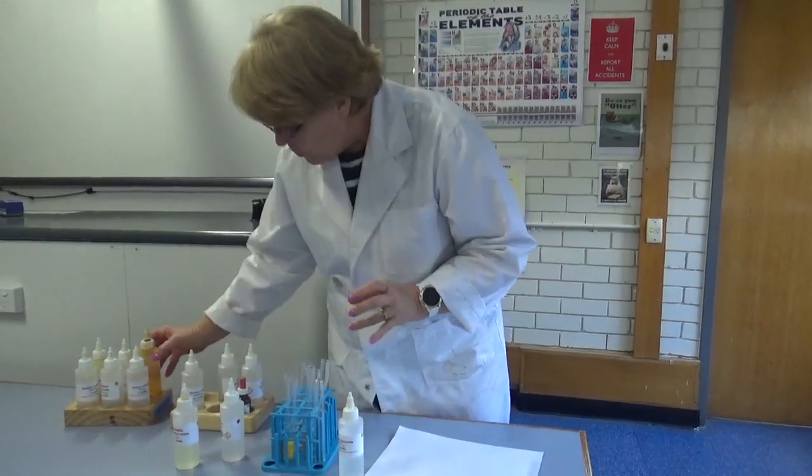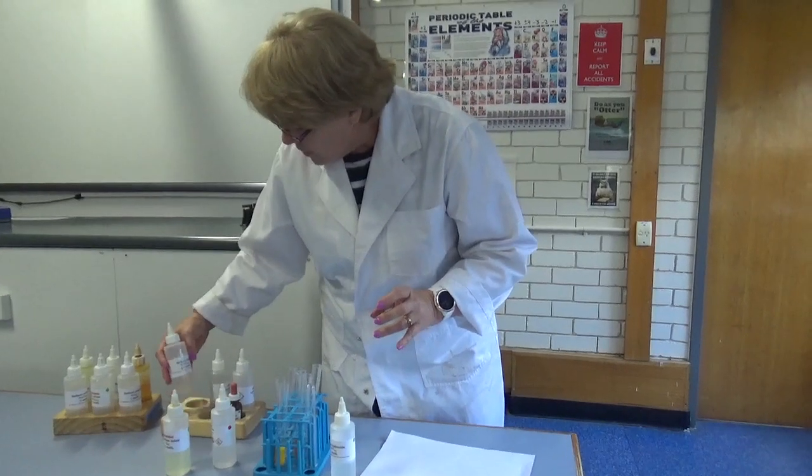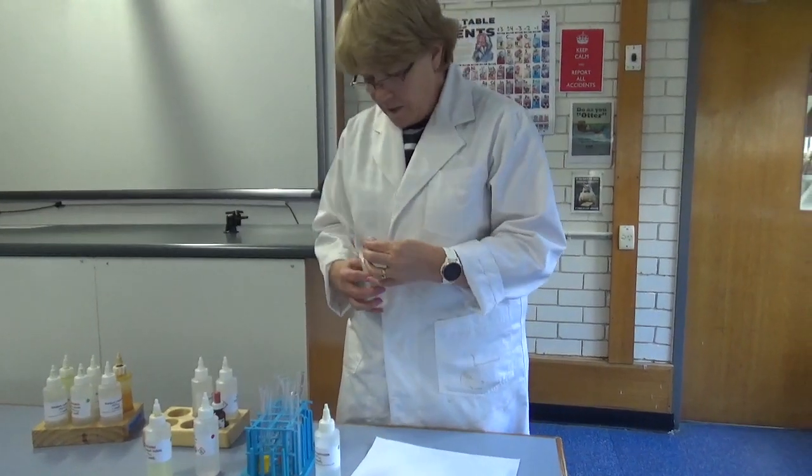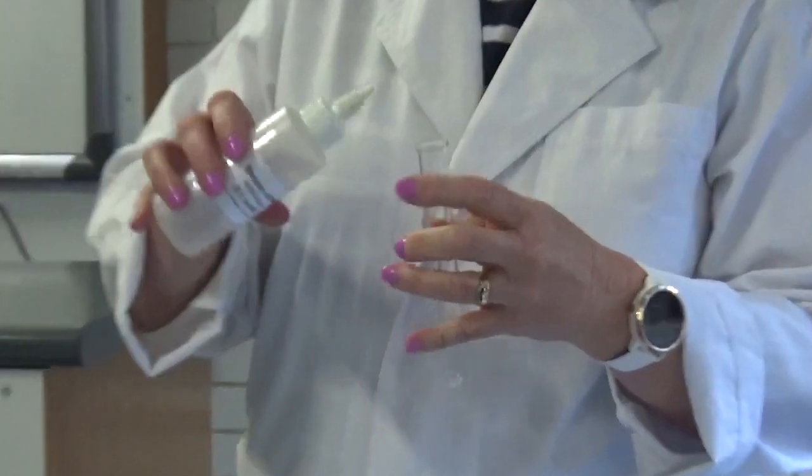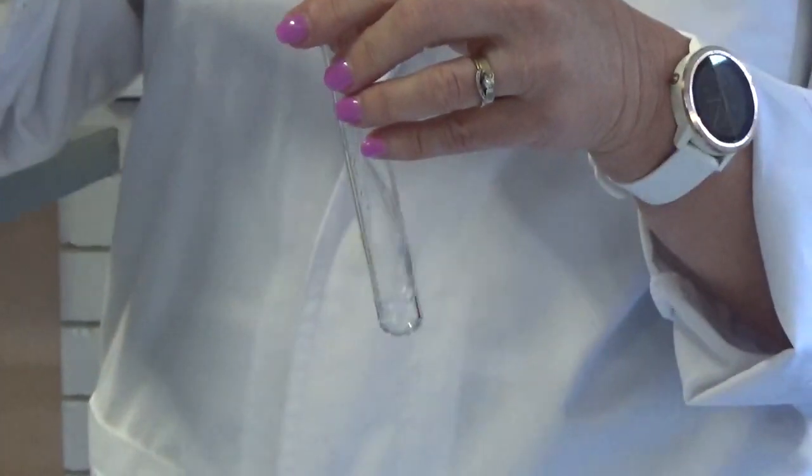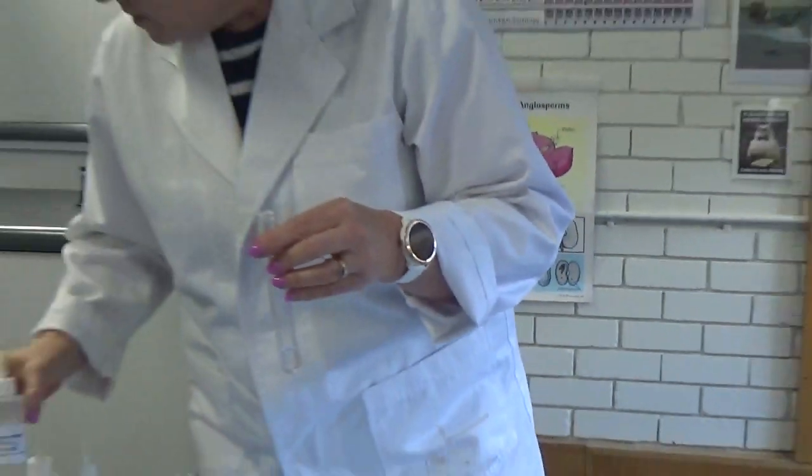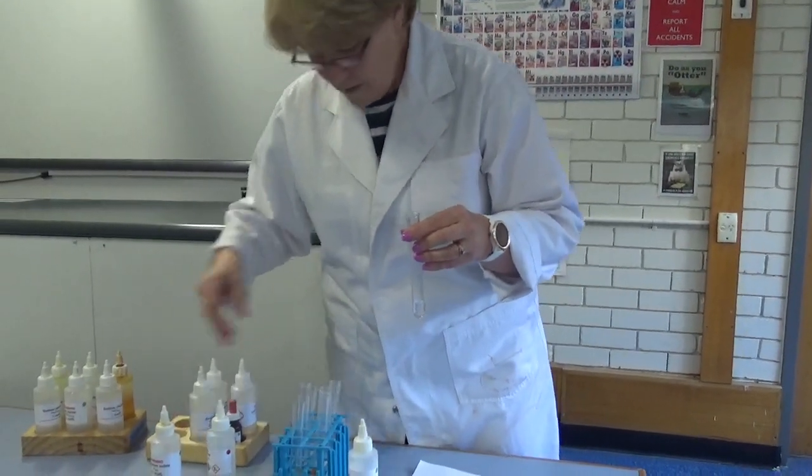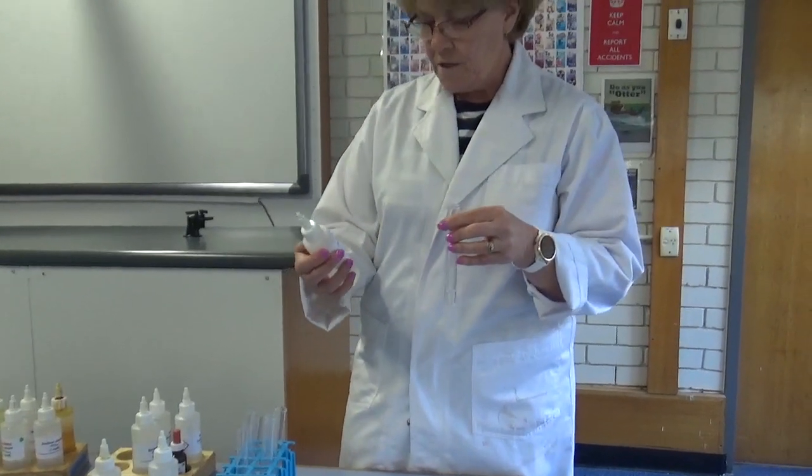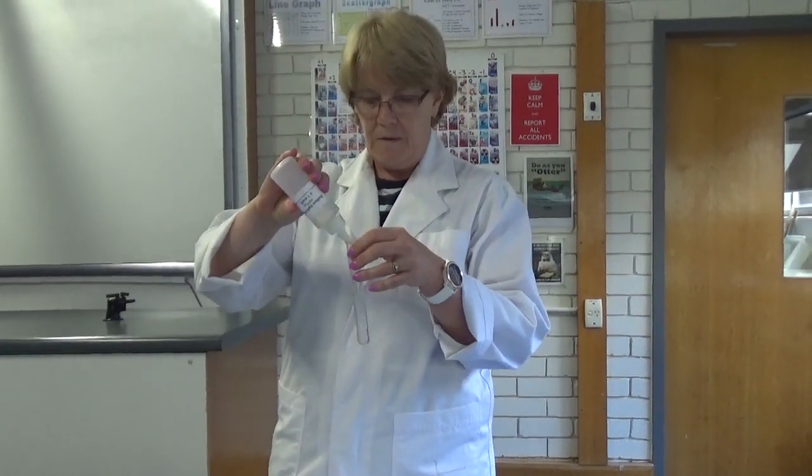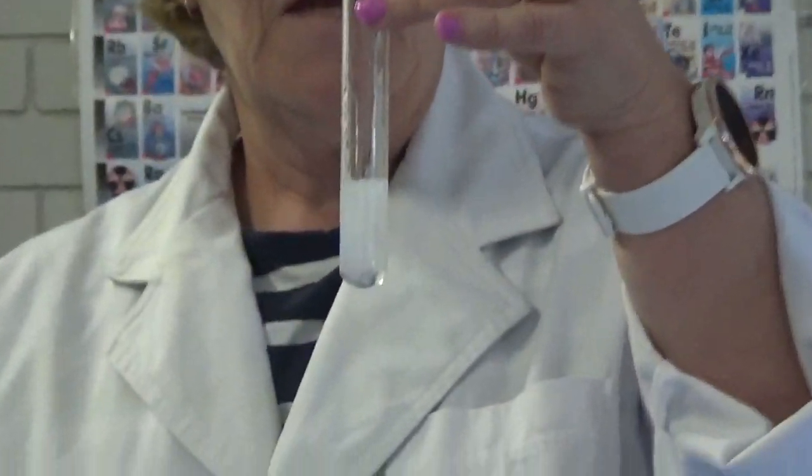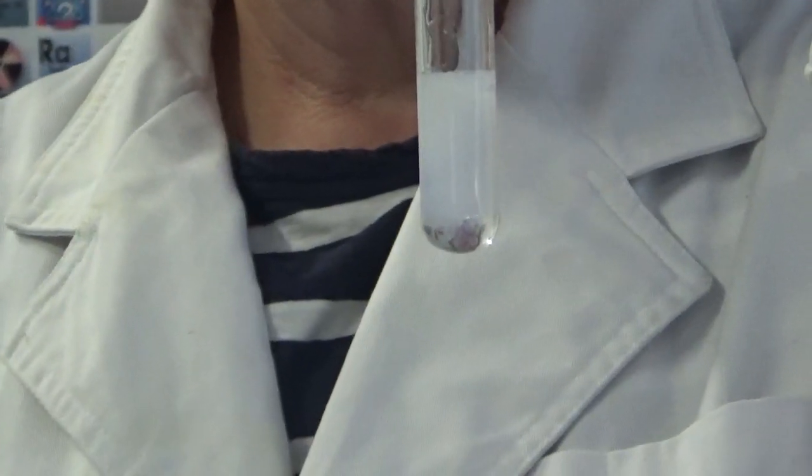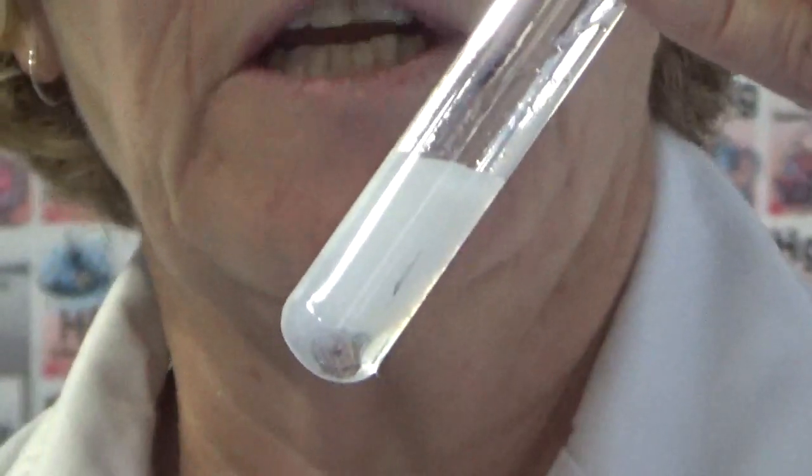And we've got time for one more. Let's try some barium nitrate. And we're going to try some sodium hydroxide with that. Oh, there's another one happening. Again, you can't really see the solid, but it's kind of jelly-ish.